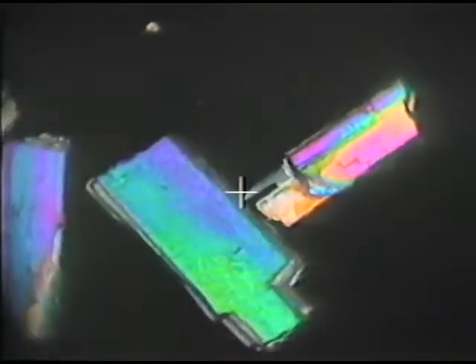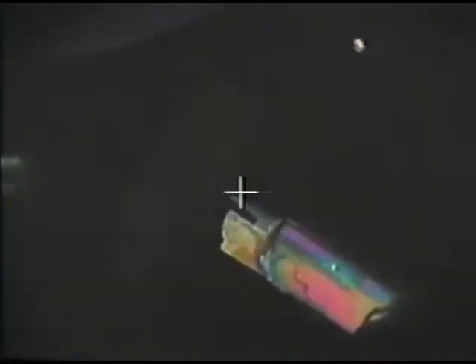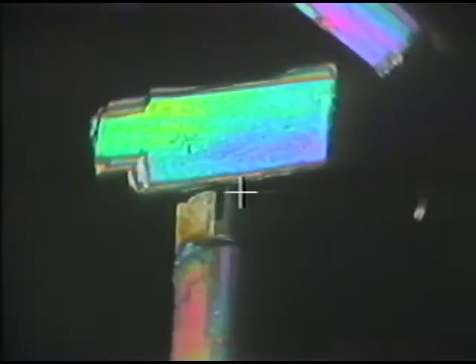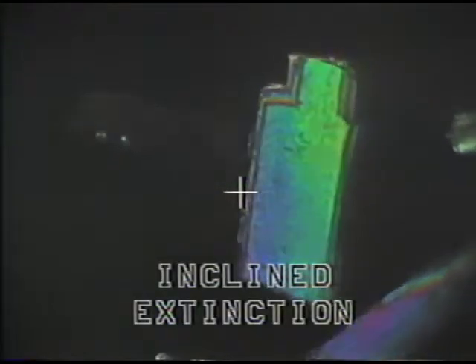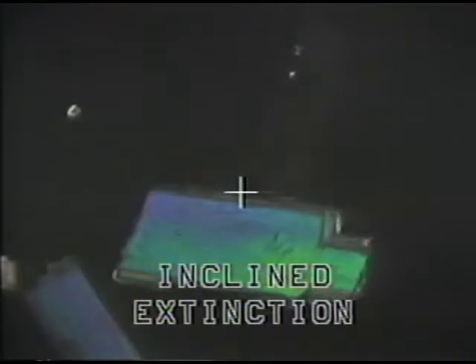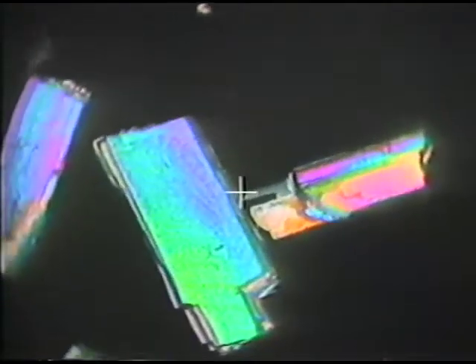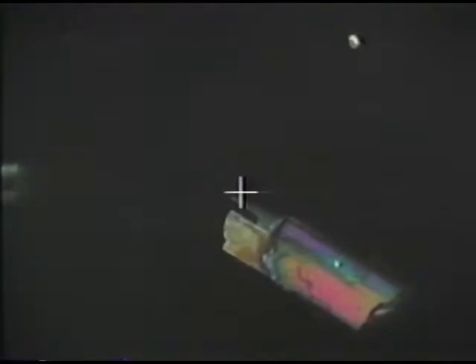Again, I want to point out here that this particular mineral goes to extinction at an angle to the crosshair, when the elongation of the mineral is at an angle to the crosshair. This kind of extinction is called inclined extinction. And many minerals, especially those in the less symmetrical crystal classes like monoclinic and triclinic crystal classes, show inclined extinction.